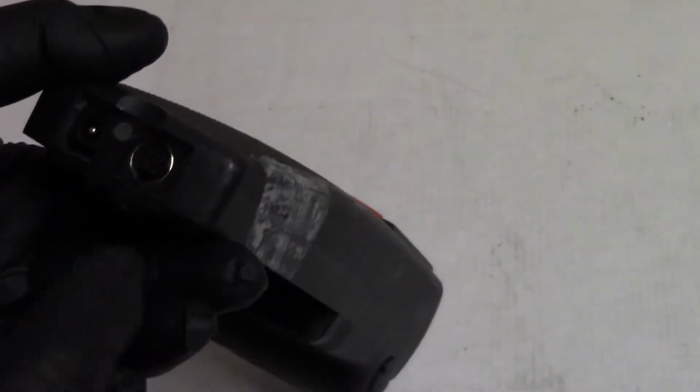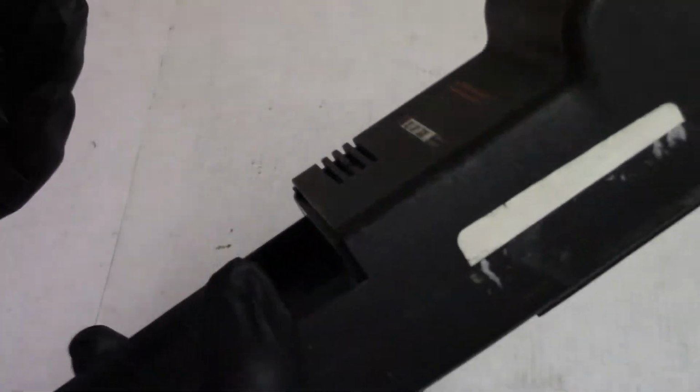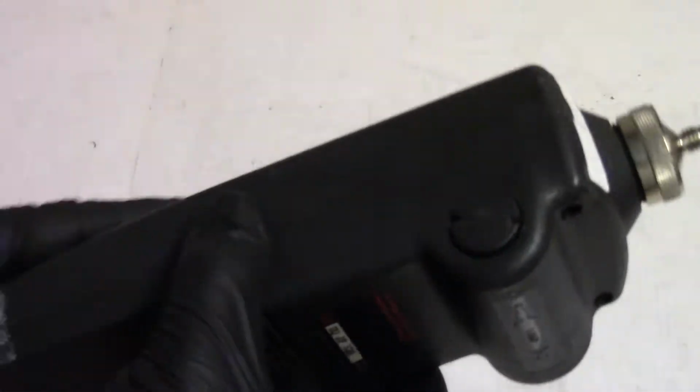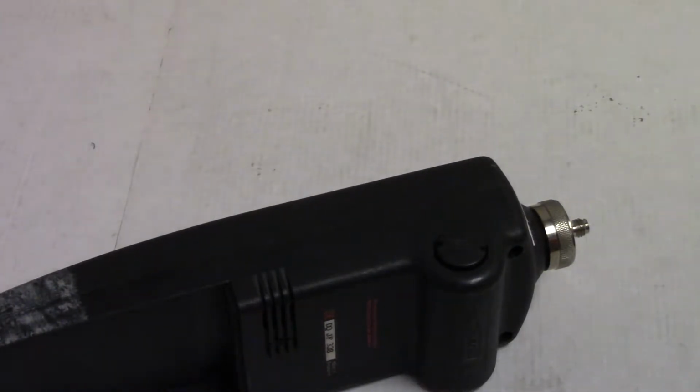If you have the other kits, you can have it print out your readings. You can probably dump it to a computer. This is 1998, so it's not a USB type thing. They probably had some fancy expensive dongle or something you had to buy. But I don't know, the fact that they're still using these is pretty good.